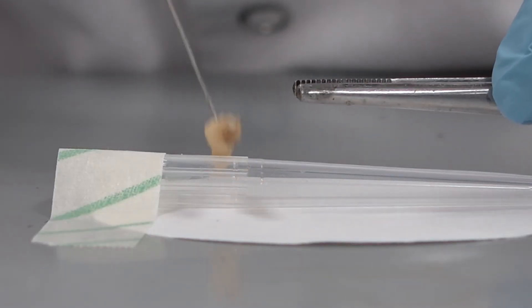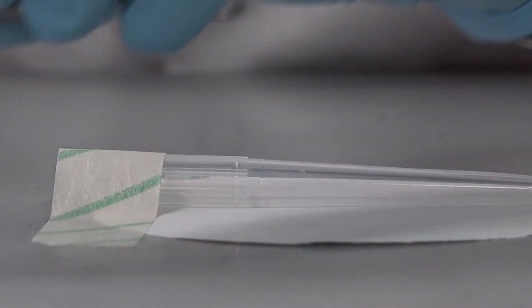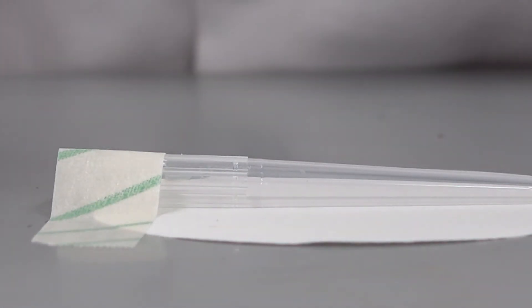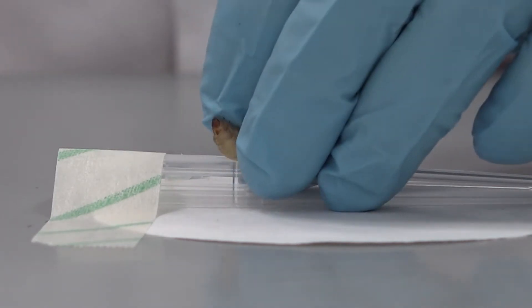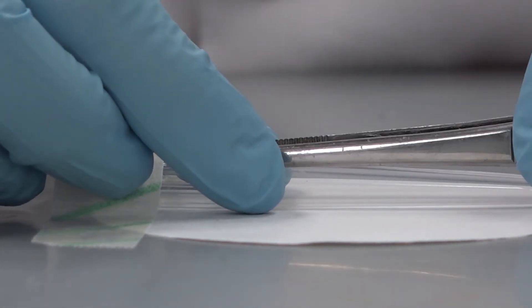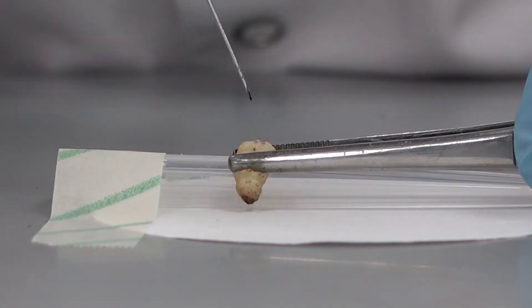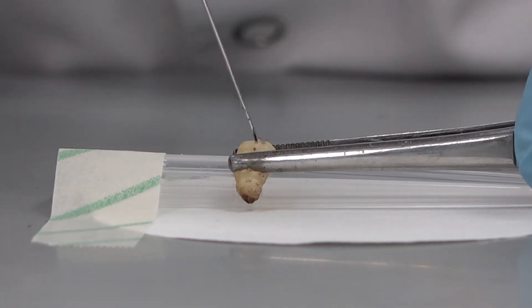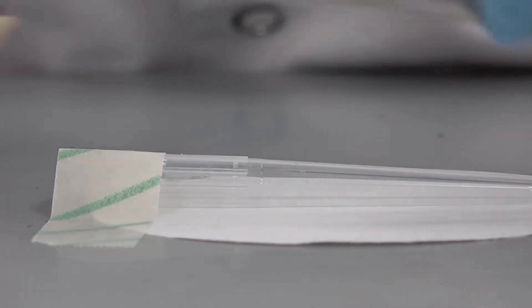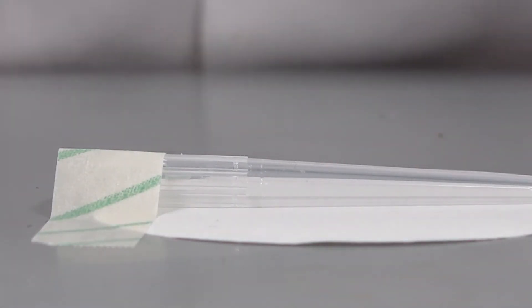Therefore, there is a requirement for tests that can better predict toxicity in mammals. Galleria mellonella larvae are considered to be a non-animal technology (NAT), yet larvae reflect some aspects of the complexity present in mammals and are accepted as an ethical alternative for toxicity testing.